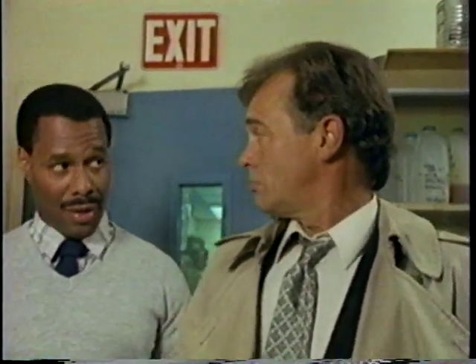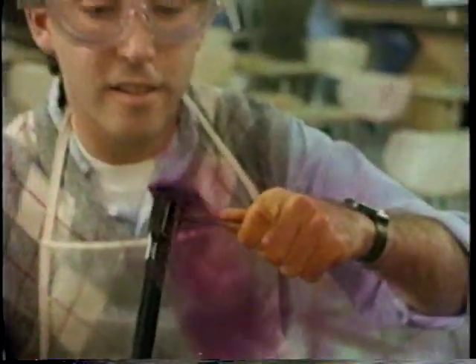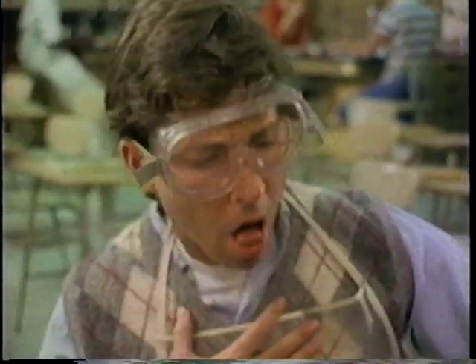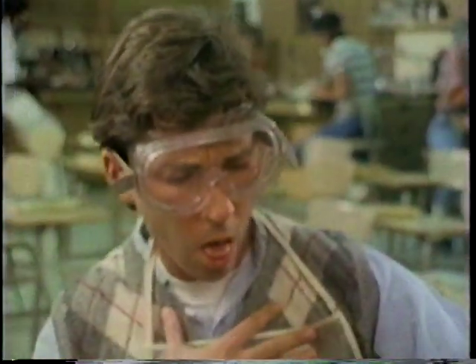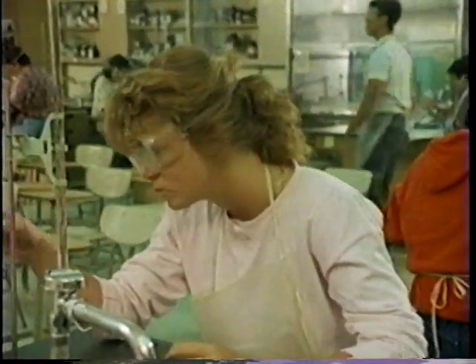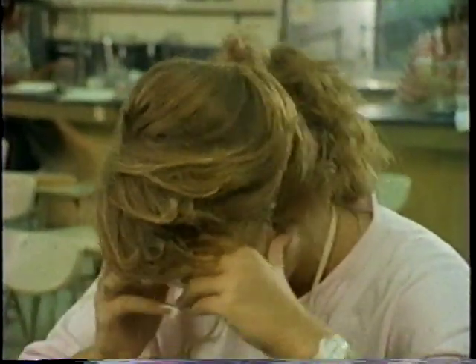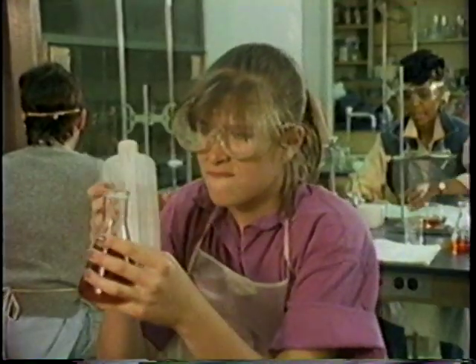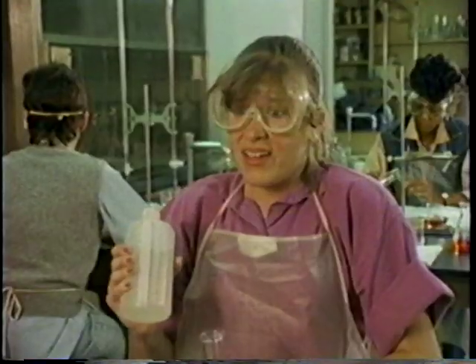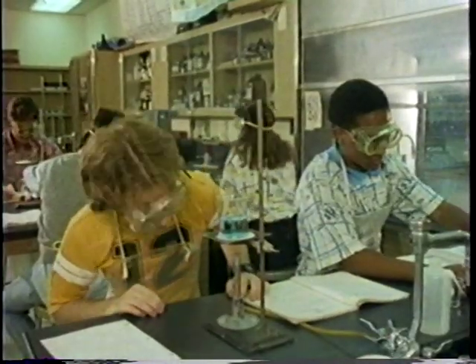Then there are all the other dangers. There's more? Afraid so. Smell a chemical the wrong way, you could be out for the day. Drink out of a beaker, I don't care how clean it looks. You never know what could happen. Squeeze bottles. Squeeze them too hard, somebody might not like it. Sorry. Light a gas burner the wrong way, and it could be lights out.